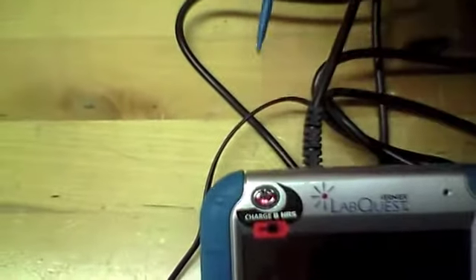So this is the thing. When you come up to it, like I said, it's all plugged in and the battery is no good really, so it's plugged in. There is a stylus that you'll find in the back that you're going to have to pull out to be able to use. So to turn it on, you push this button on the top left-hand side, and you'll see the screen looks like this.